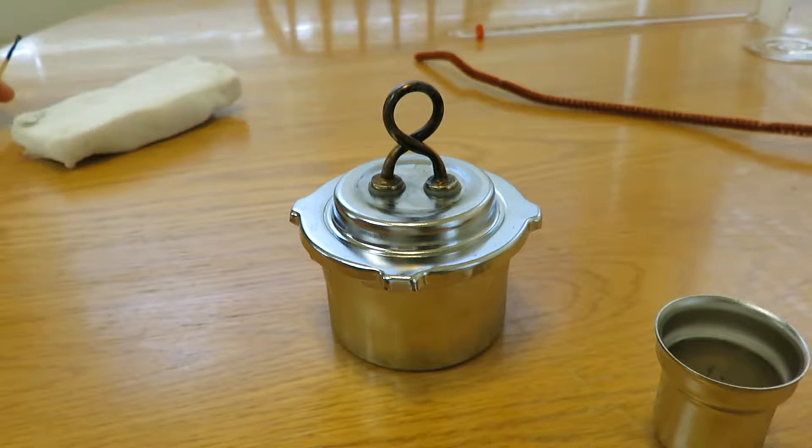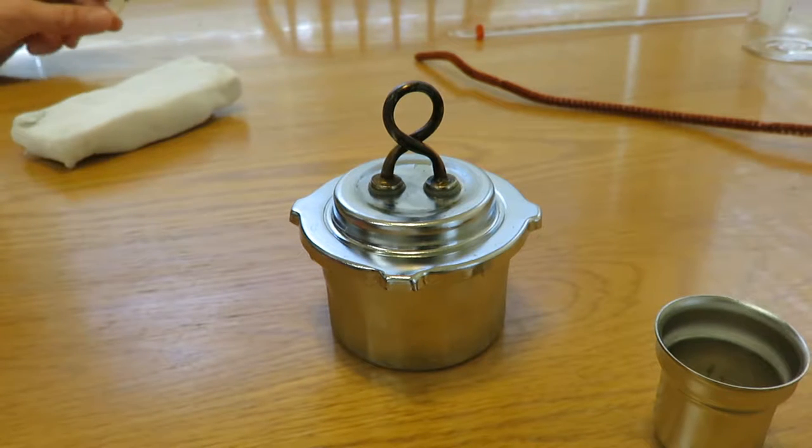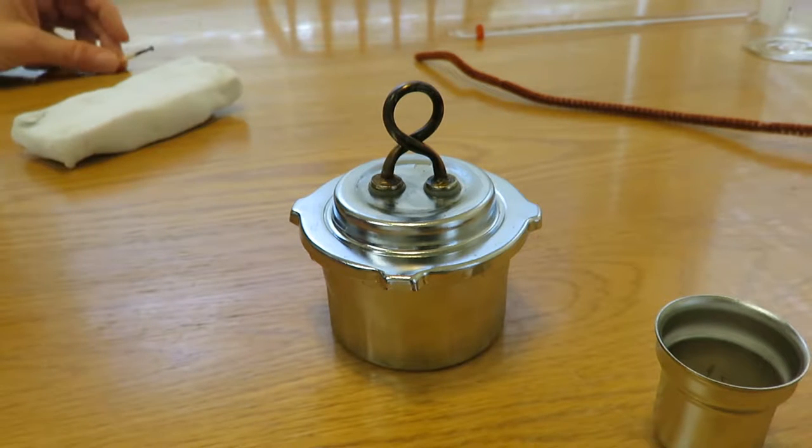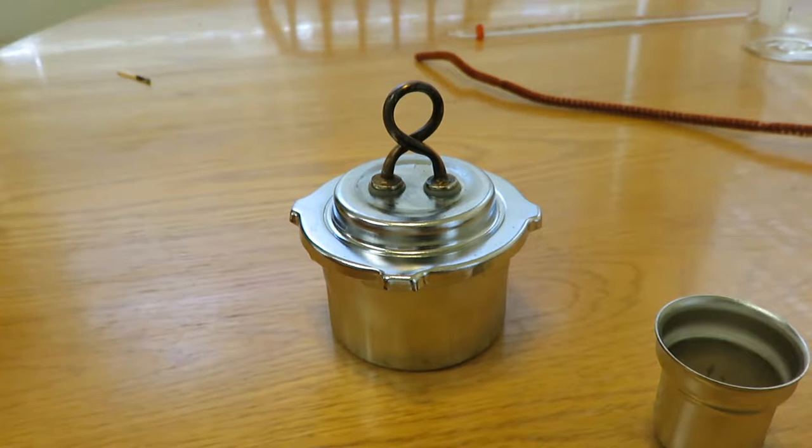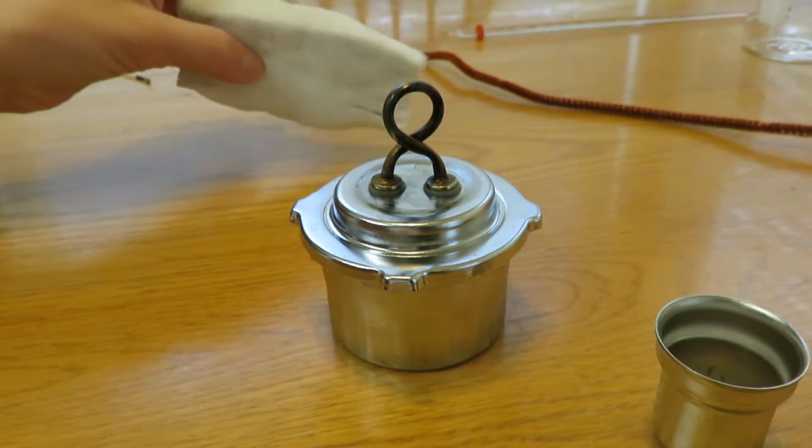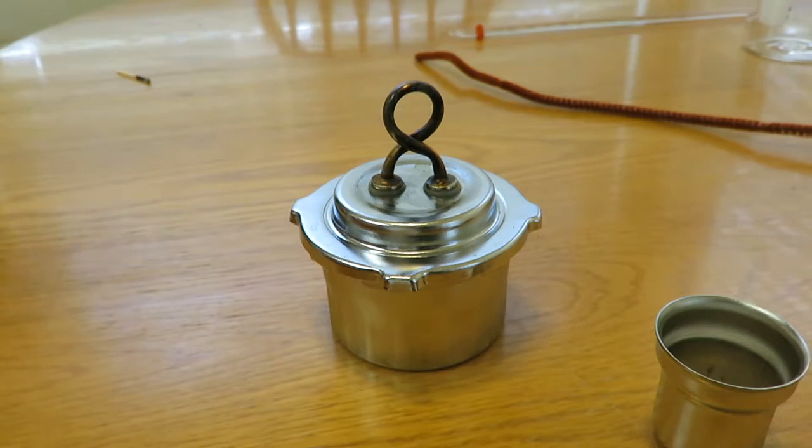I contacted the company because the instructions weren't specific about how to clean it. I asked them, 'Is a magic eraser going to be okay?' They said, 'Yeah, why don't you give that a try.' And they said for underneath you might want to use a wire.